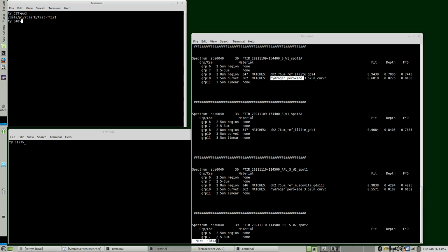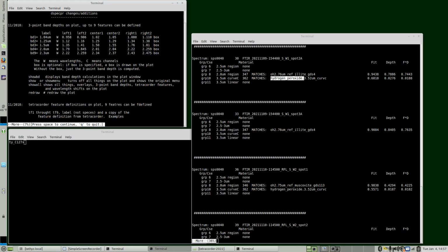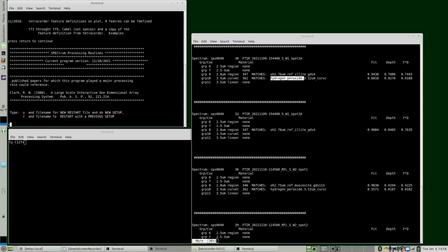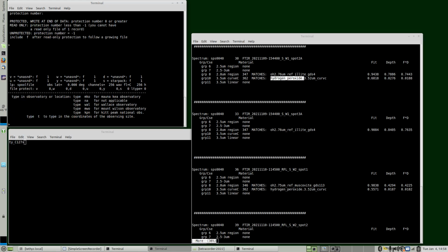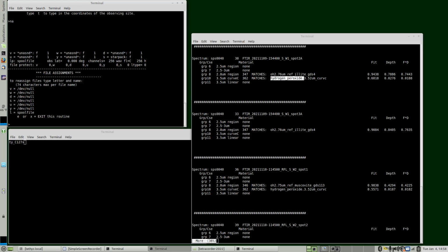So I've set up a directory over here, and I'm going to start specpr. We're going to assign the spectral libraries. So we have a new restart file. This is a repeat of what we did in the Tetracorder, the specpr introduction in video 2. So we need to assign the spectral libraries. The spectral libraries are located in SL1/USGS. I'm going to press tab here to see what the options are.